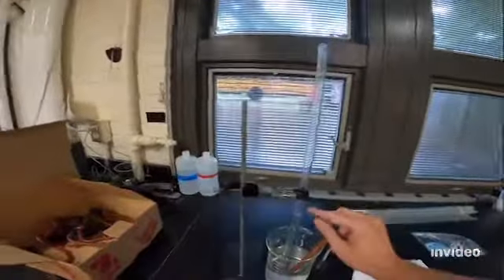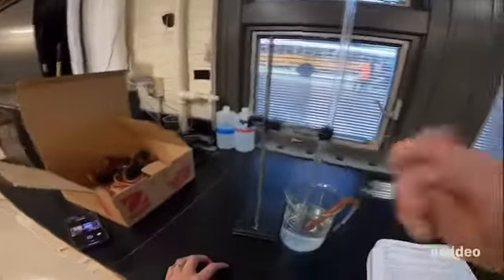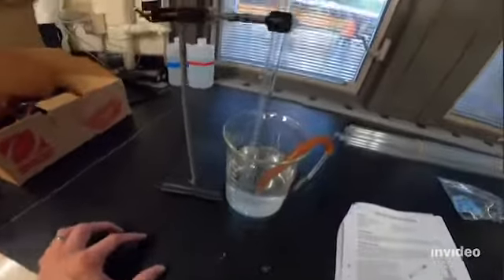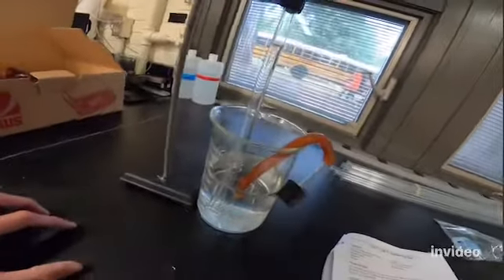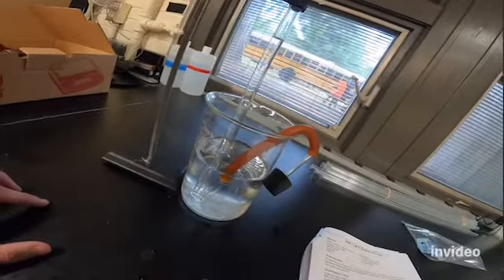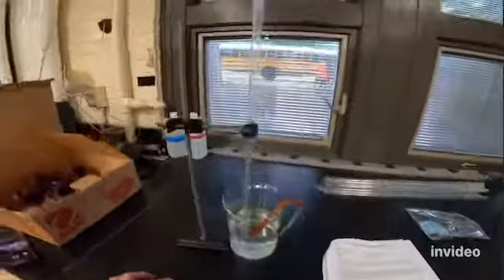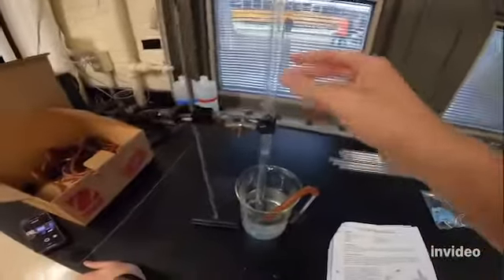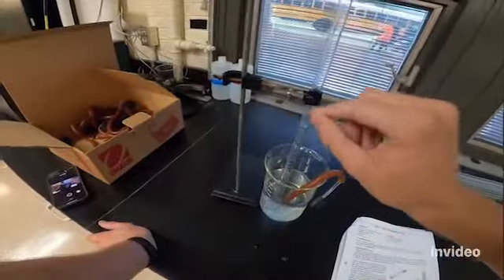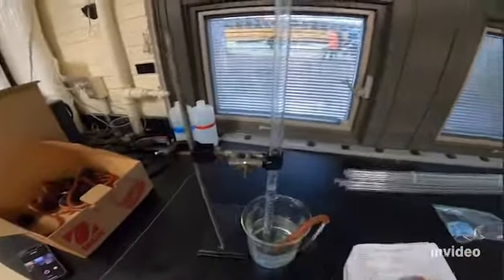So we can measure the volume of the carbon dioxide by reading the eudiometer. So I can see that mine is between 35 and 36 milliliters. I could probably read that very carefully as maybe 35.55 or so. This eudiometer has tick marks to the 10th of a milliliter, so I should be estimating to the 100th of a milliliter.